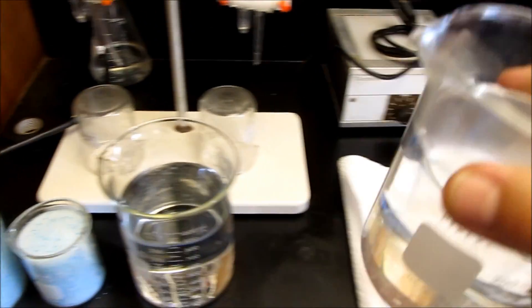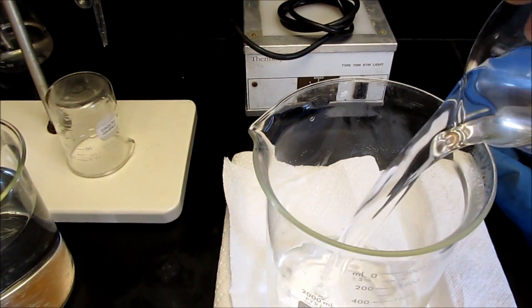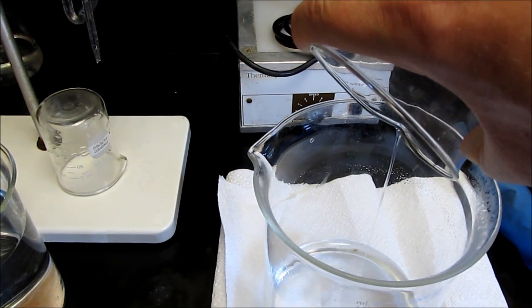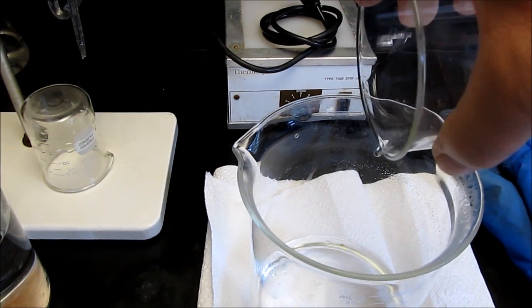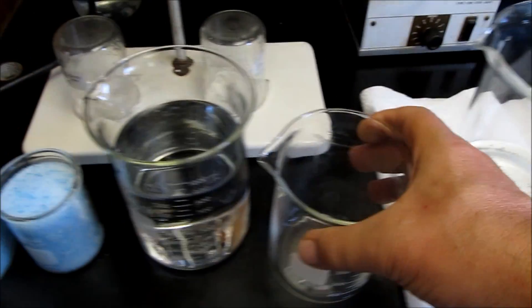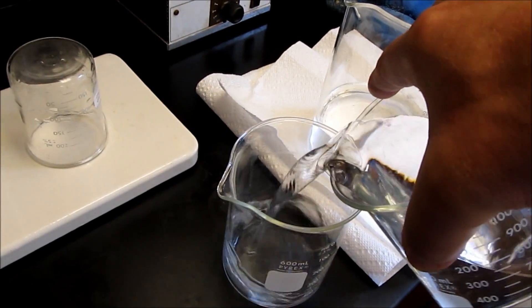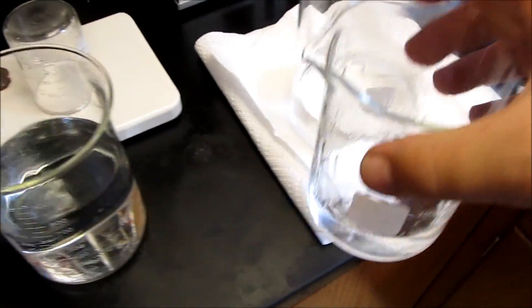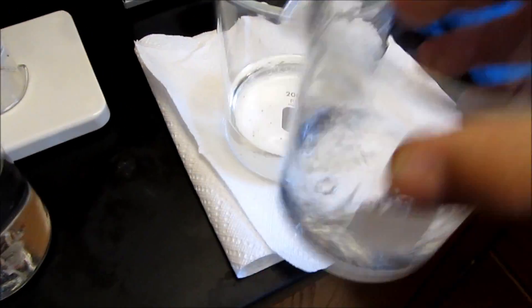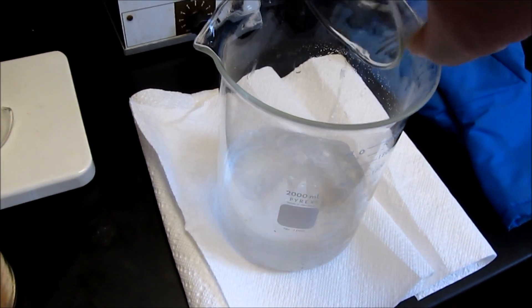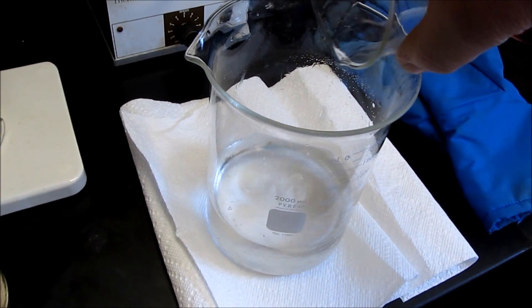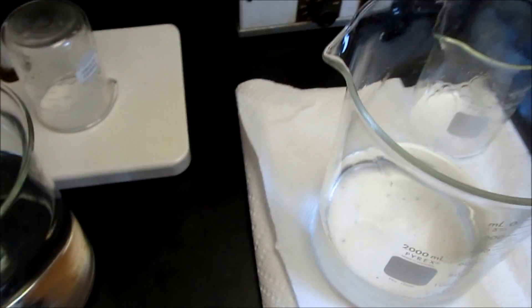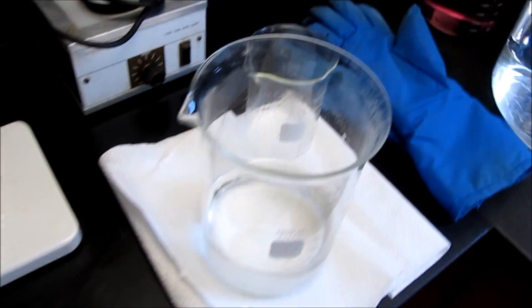All I want to do, I'll put the sodium hydroxide in, use some of my distilled water to rinse the beaker. Just do it all. Not that it really matters, I'm sure. Put the rest of the water in.